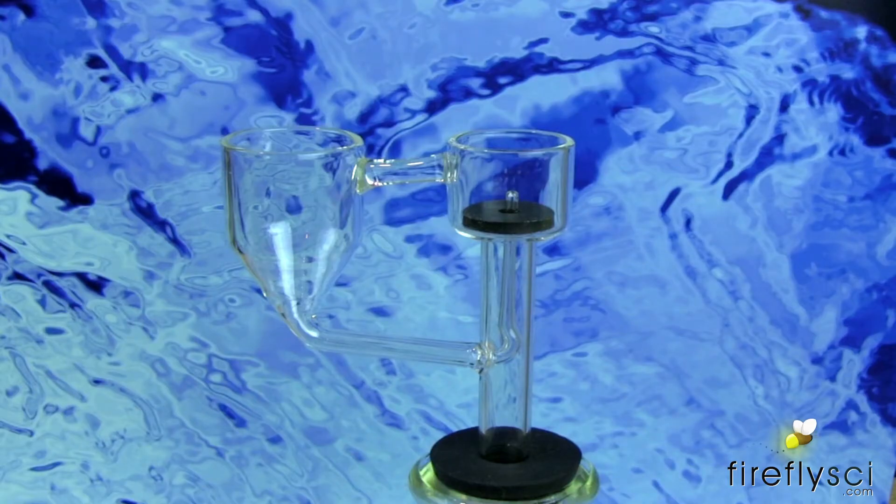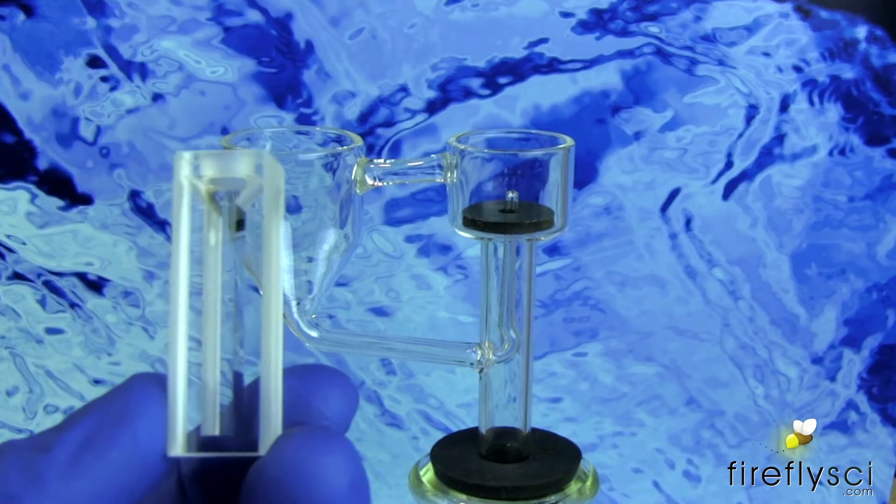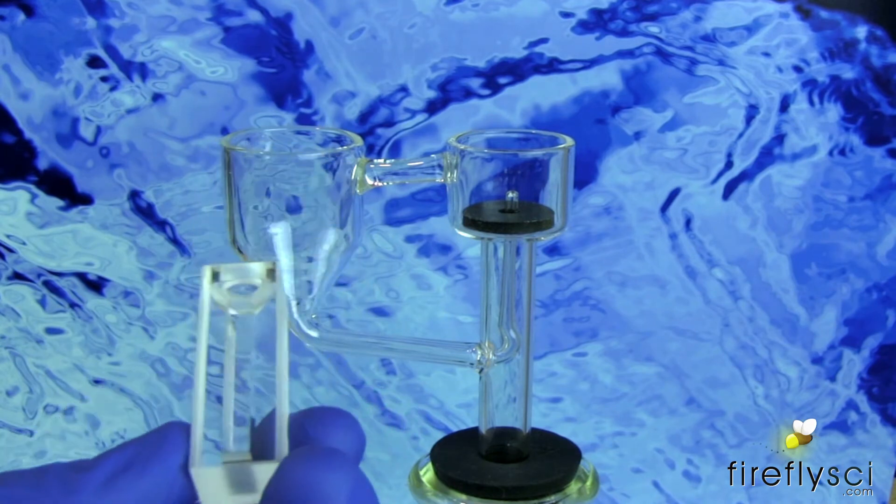Okay, so we have our cuvette washer all set up and ready to go, and I'm just getting ready to put our semi-micro cuvette on right here. This is the cuvette we're going to be cleaning today.